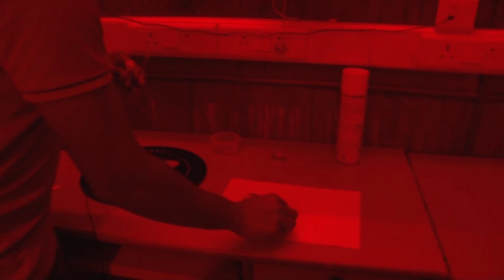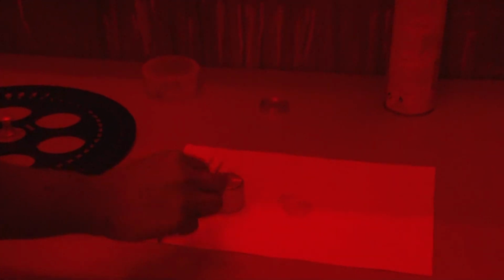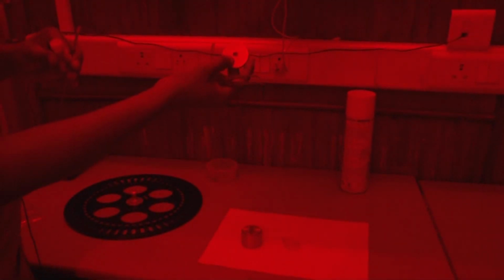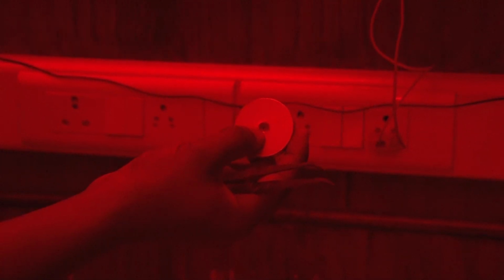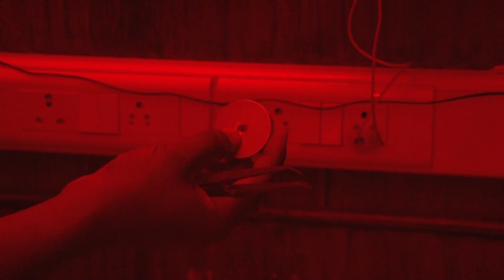We put the disc on the spacer, and here you can see one space has been given. This space is variable based on the disc size. If you want to do the coarse grain quartz dating technique, the space would be quite large, and this is the size for the medium quartz.